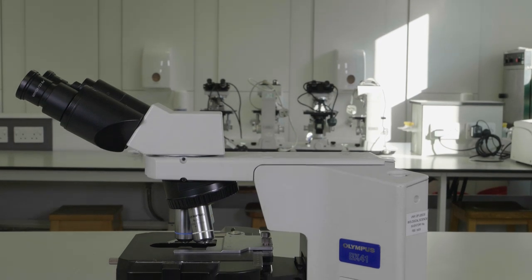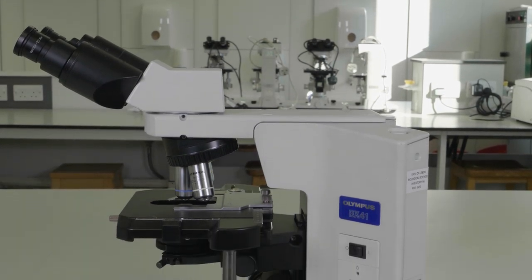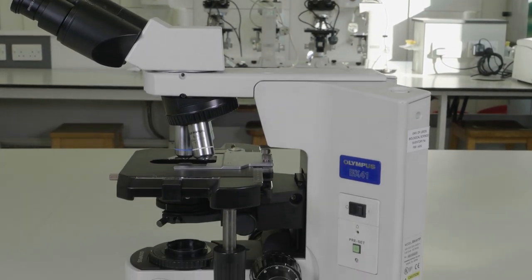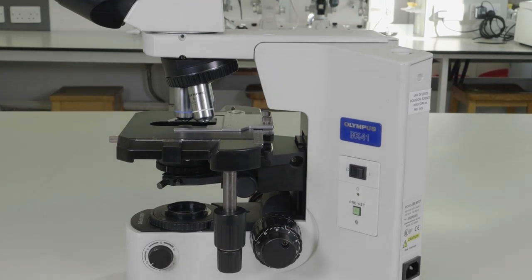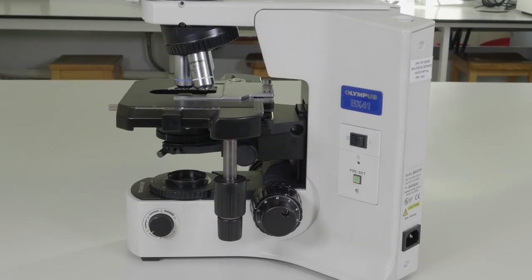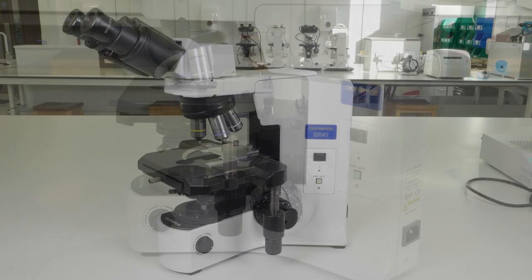We have a number of microscopes in the microbiology laboratory and for the purposes of this video we will set up the Olympus microscope. Any differences with the other microscopes will be discussed at the end of the video.